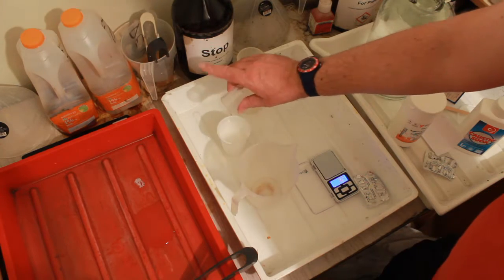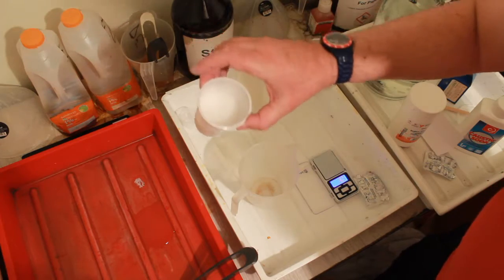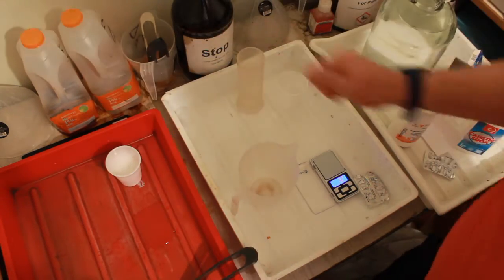That can go in there now. I think it's fizzing. All right, won't use that one again. Mmm, tasty.